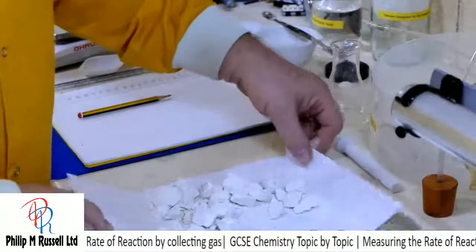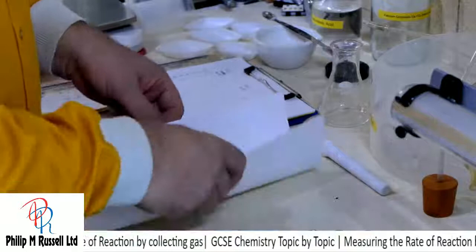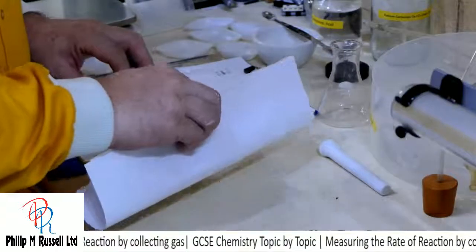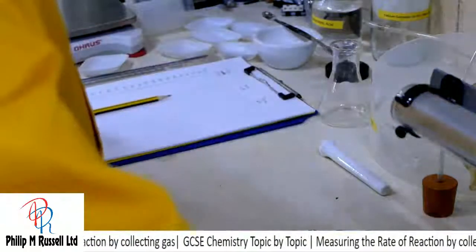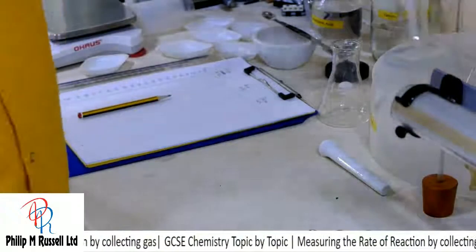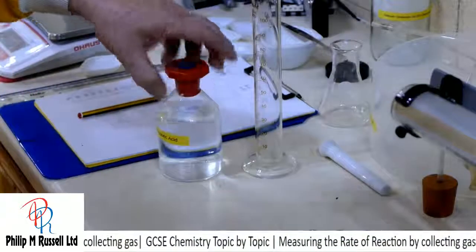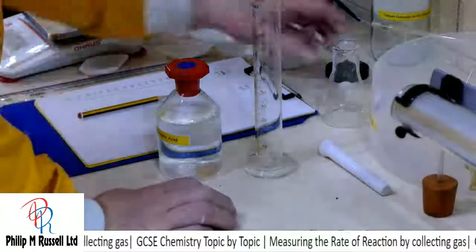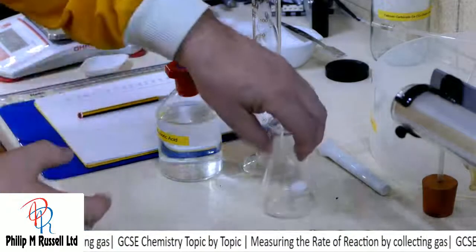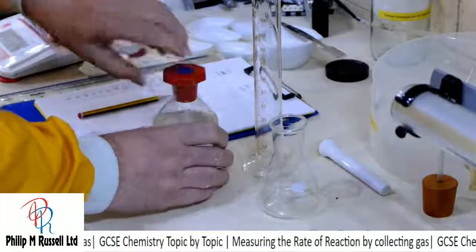So I can measure this out in a measuring cylinder, but because it's going to be in excess, it's not going to matter too much. I have in fact got a measuring cylinder here, and I'm going to put in about 30 mils of acid.